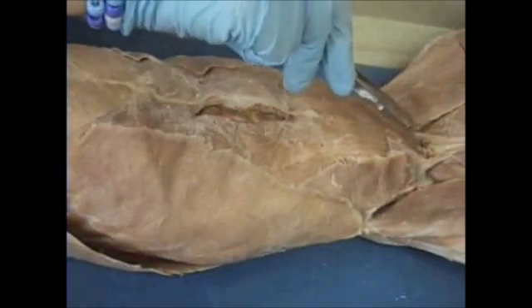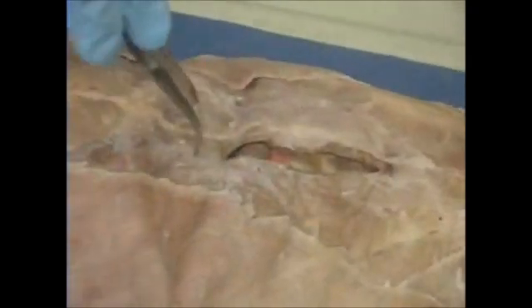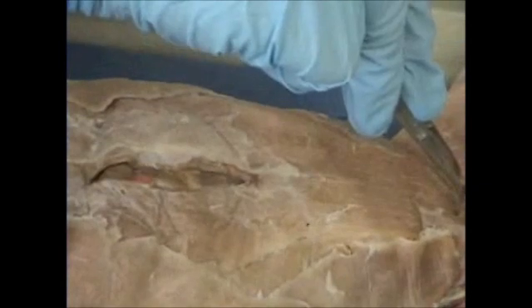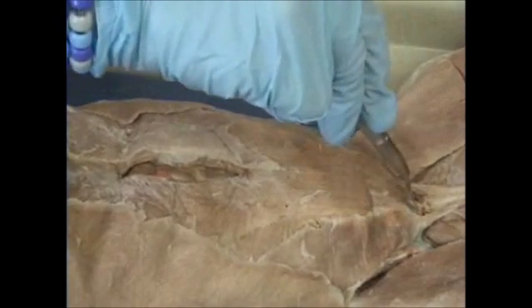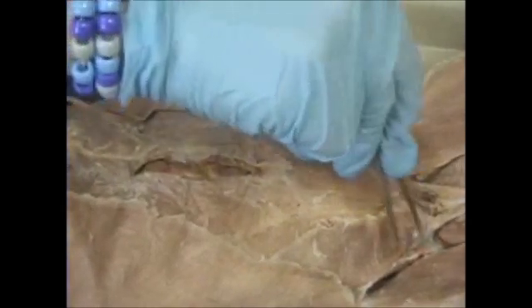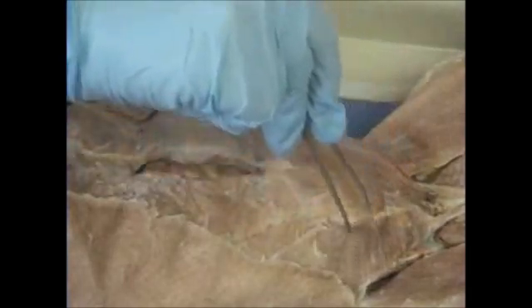Running straight from the top to the bottom, you have your rectus abdominis muscle, your six-pack. Rectus abdominis muscle. So they could have a pin here, name this muscle, rectus abdominis, or they could have a pin here, name this muscle, internal oblique. So be very careful. If striations run straight from top to bottom, it's rectus abdominis in the center. If the striations run up or somewhat medially, diagonally, you have your internal oblique.